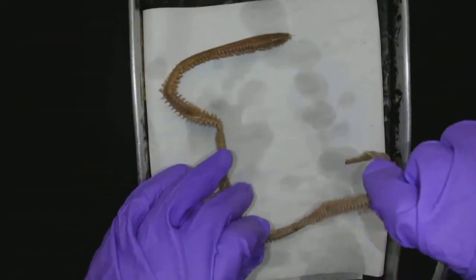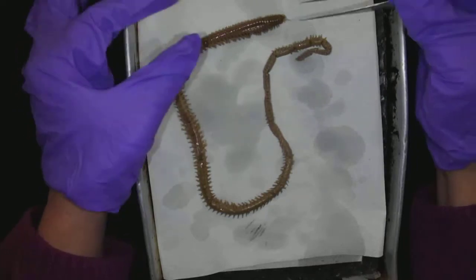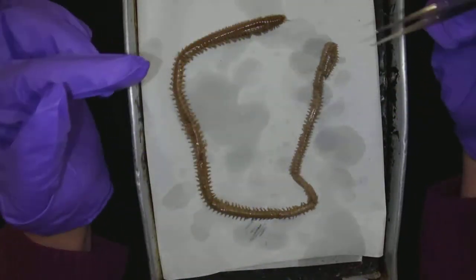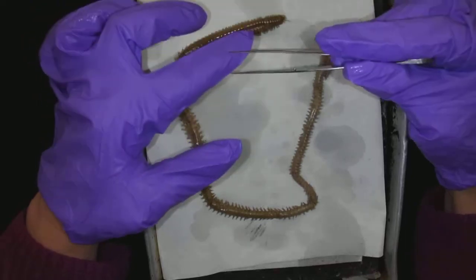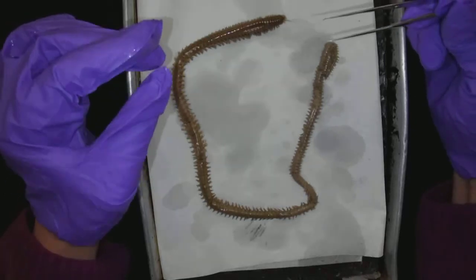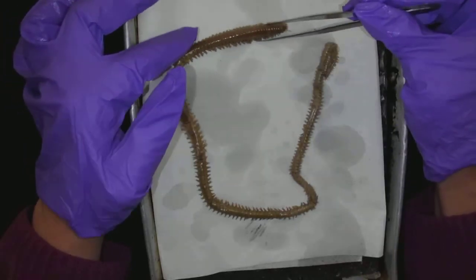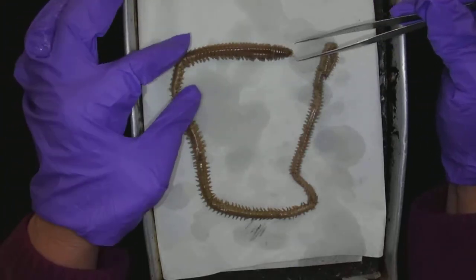The entire worm has got several parapodia all up and down the animal. Now marine worms, there are lots and lots of different varieties of them. This is just the standard marine worm, Nereis, that we're going to be studying. I do have to warn you, if you go out to tide pools and look for these — particularly if you're down in Baja — there are some where the setae come off and get into your skin. It's kind of like those really fine cactus spines. It hurts, but not terrible, but they can cause a rash. So those setae are nothing to play with — beware of that. You've got to know which worm you're grabbing. There are some they call fireworms because they get into your skin and it burns, especially in salt water.